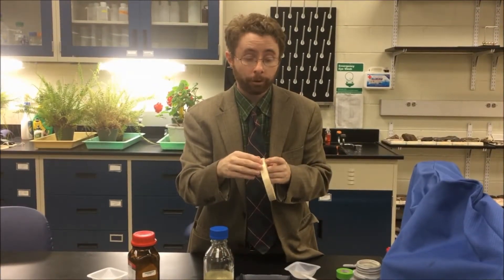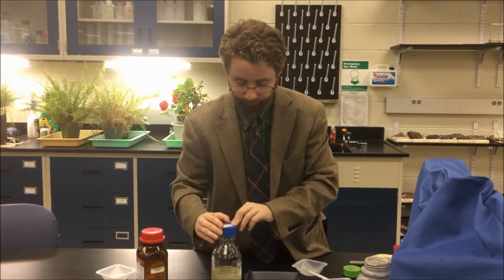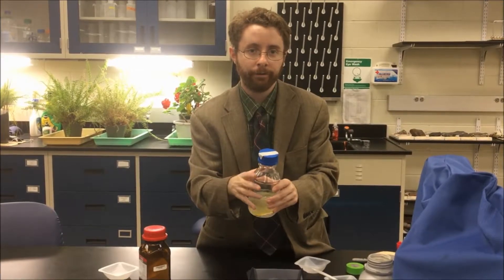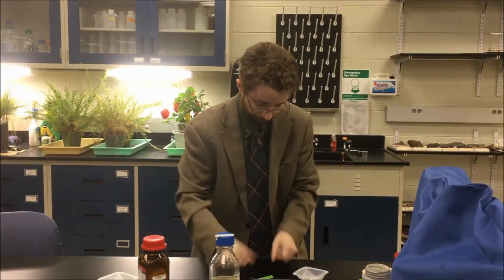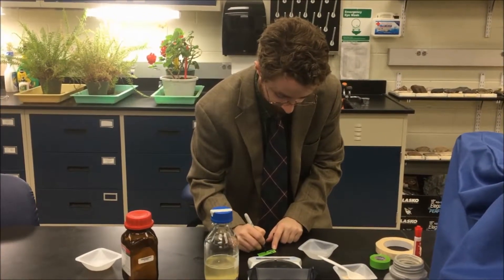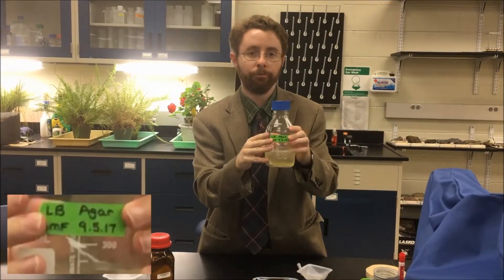I'm going to take a piece of autoclave tape and rip off a small piece. Right now it's white. I'm going to attach it to the lid. After this is autoclaved, the tape is going to change color to show black lines, which indicate that this bottle was autoclaved. I'll take some lab tape, write out what I've just prepared — so it'll be LB — put down my initials and today's date, and attach that also to my bottle.